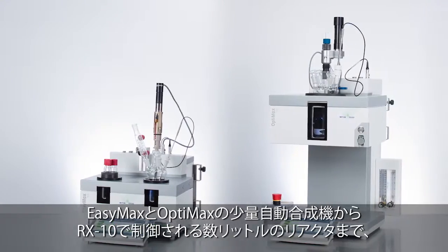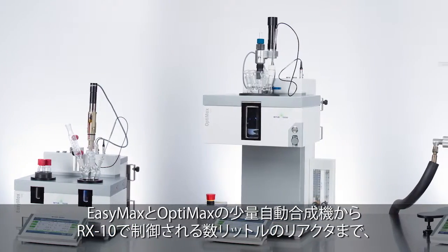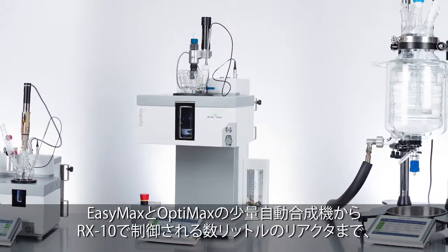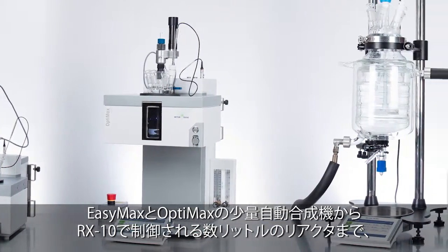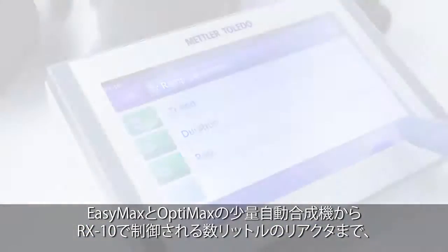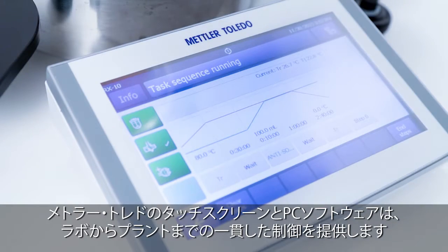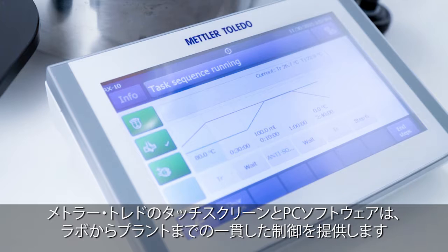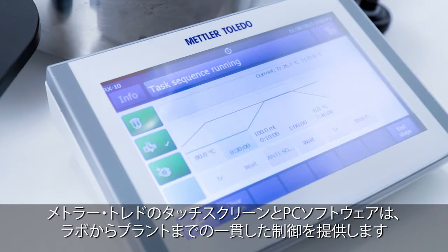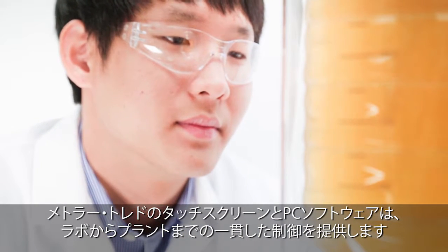From the smaller scale EasyMax and OptiMax synthesis workstations to multi-liter reactors controlled by the RX10, Mettler Toledo touchscreens and PC software provide a consistent user experience from research to manufacturing.